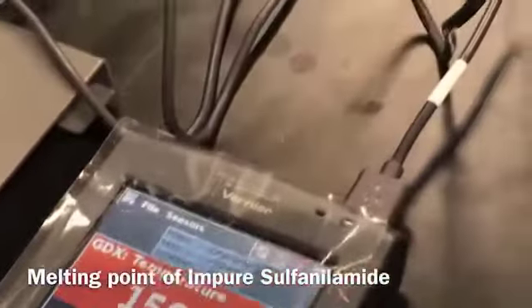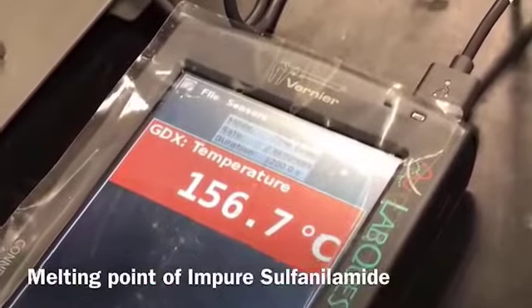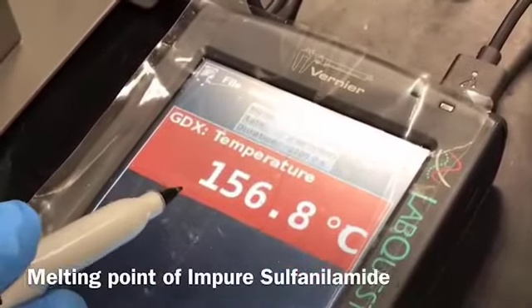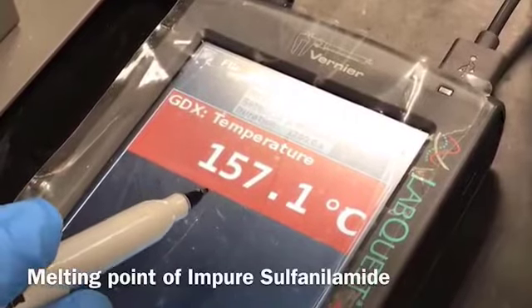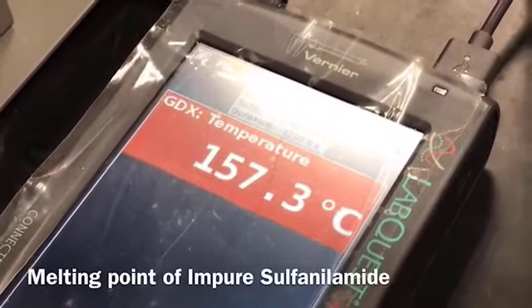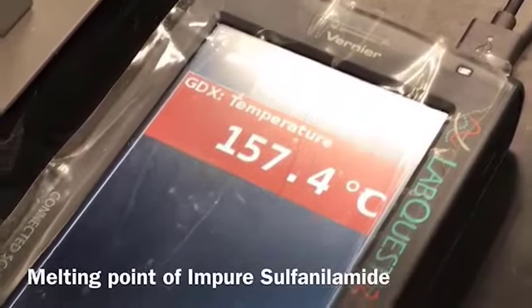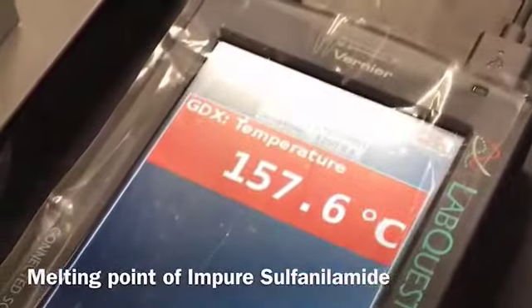The sample is about to start melting. It just started melting now. You can say 156.8. Since it is an impure sample, the range is going to be broad, and it is still melting.